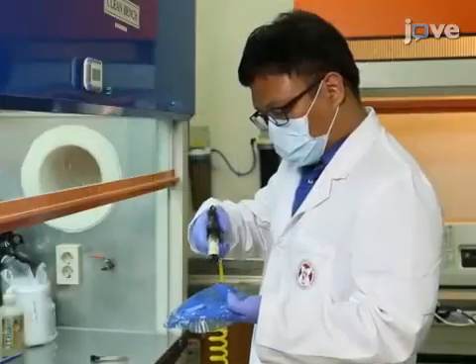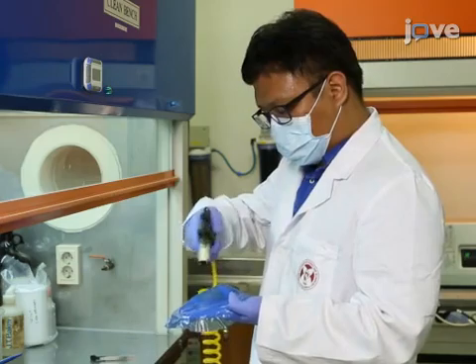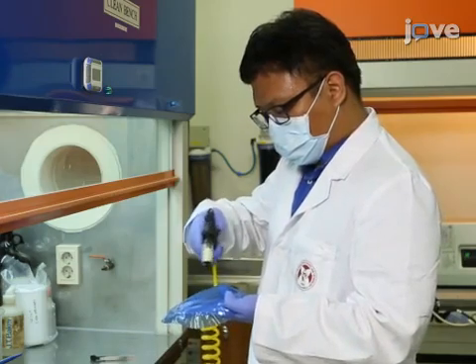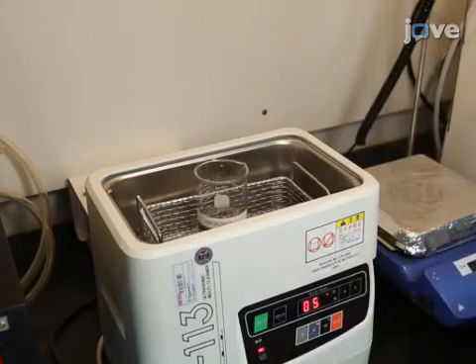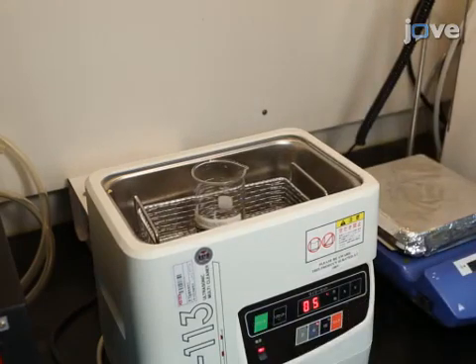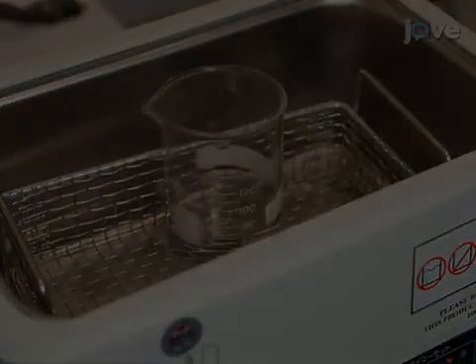Blow the pieces using a compressed nitrogen gun to remove any particulates resulting from the cutting step. Next, place the cut wafer into an ultrasonic bath of deionized water for 5 minutes at 45 degrees Celsius. Remove the photoresist layer using an ultrasonic bath of acetone.